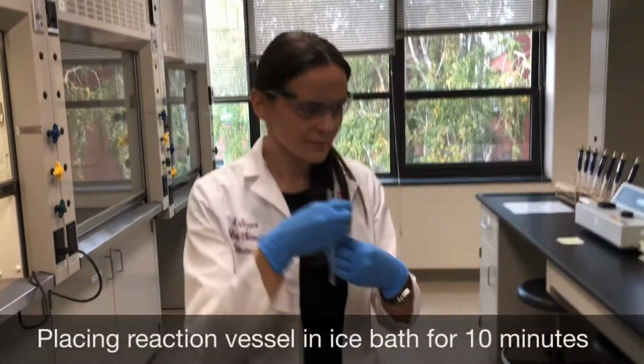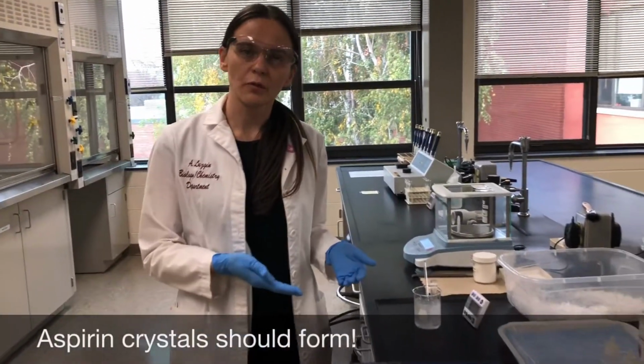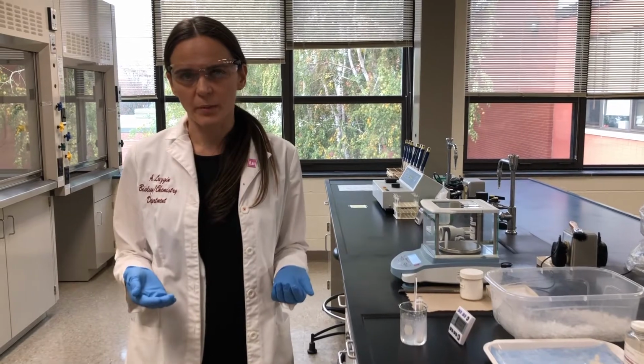What I'm going to do now is put my reaction vessel into an ice bath for 10 minutes. So during the 10 minutes, we should see crystal formation. So I'm going to check on my reaction vessel after about a minute or so to ensure that crystals are forming.